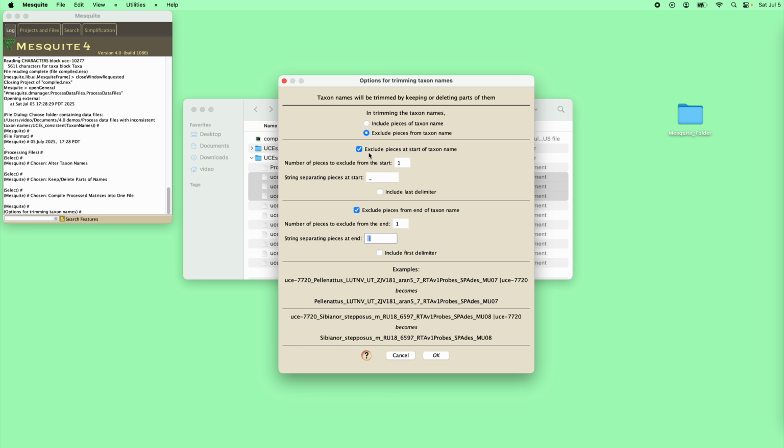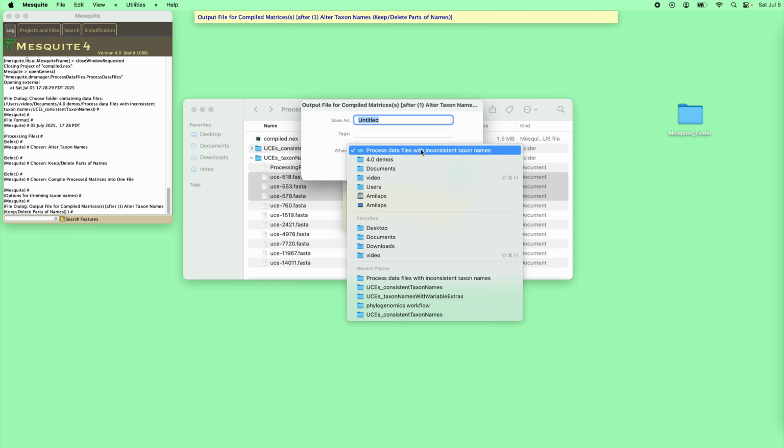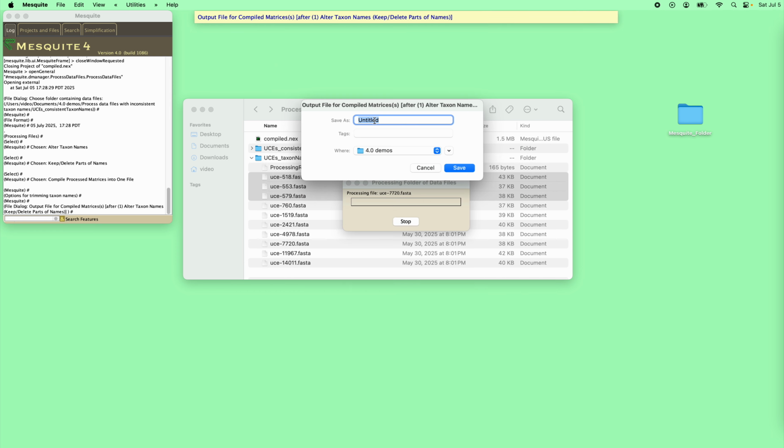So this is how we trim the taxon names so that they end up excluding those UCEs. What we've asked for is to exclude from the start of the name one piece delimited by an underscore. That gets rid of this bit here. And exclude from the end of the taxon name one piece beginning with here, and that excludes the last bit. And so we've cleaned up the taxon names. As each locus comes in, it'll get cleaned up, and there'll be consistent taxon names. And now we do this one.